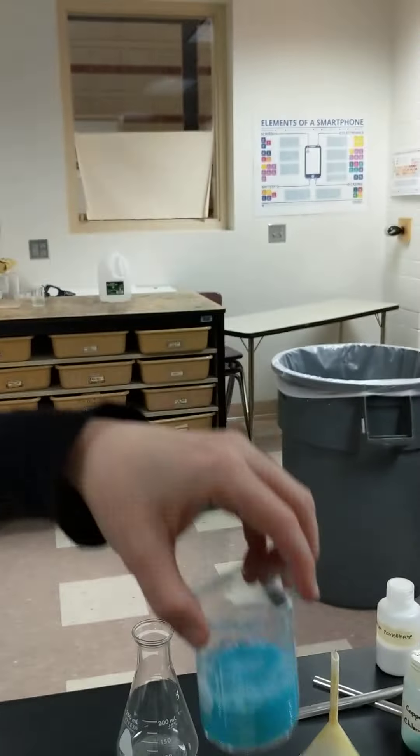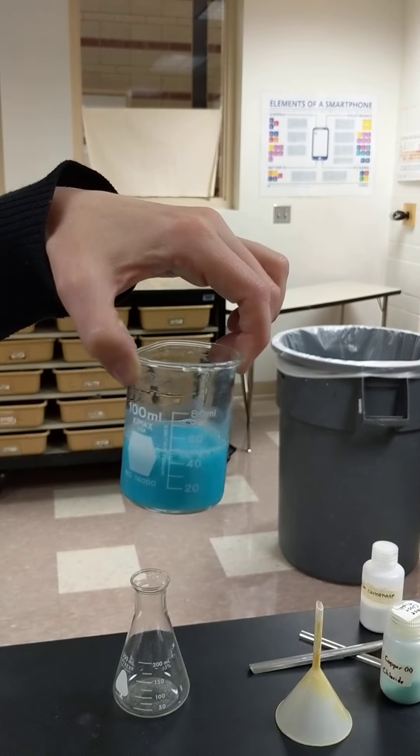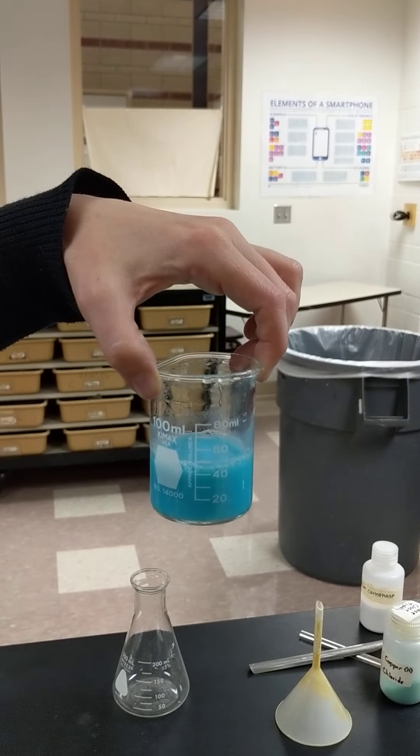So then we need to filter. It got cloudy because there's a precipitate in there, and we learned what a precipitate is today. And so we need to filter out that precipitate.